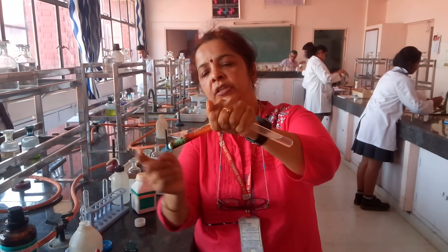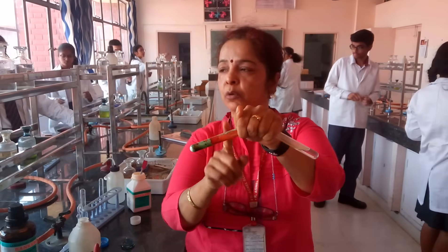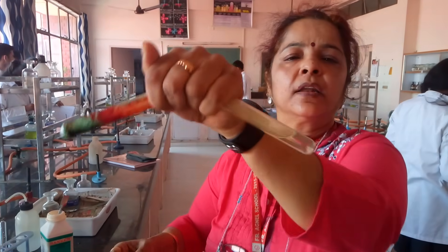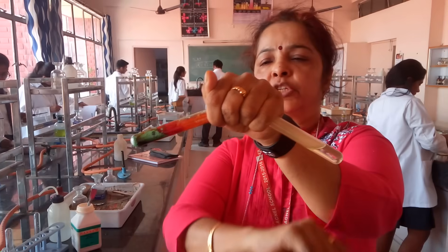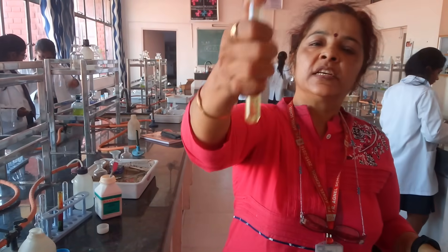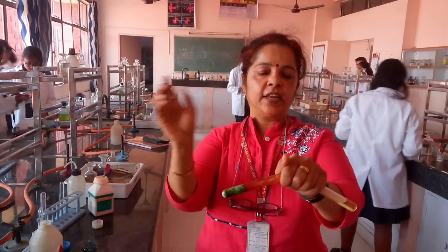Please do not tilt it further — the contents of the test tube may fall into the NaOH solution, which is not allowed. Be slow and patient. Wait for some amount of gas to pass into the NaOH so that the color of the NaOH solution starts changing. You can observe the yellowish gas passing through the solution and the color of the NaOH solution is changing. None of the contents of the first test tube should pass into this test tube. This solution has now turned yellow — this is sodium chromate, formed because of the chromyl chloride gas purged into the NaOH solution.